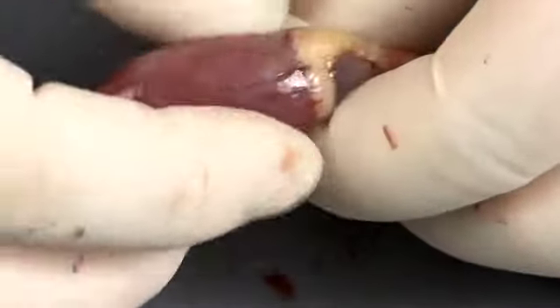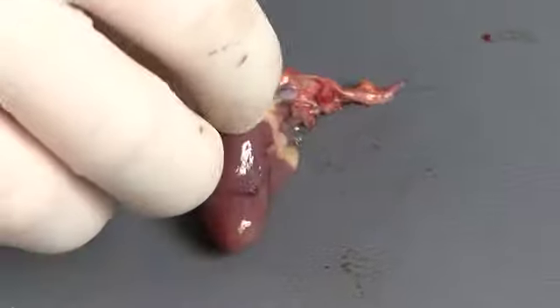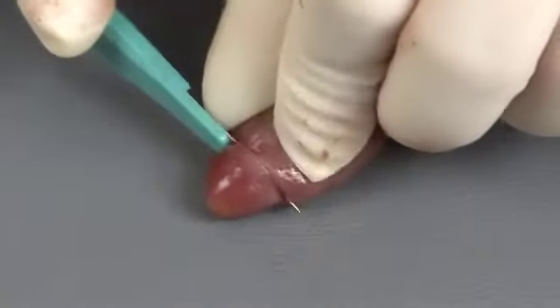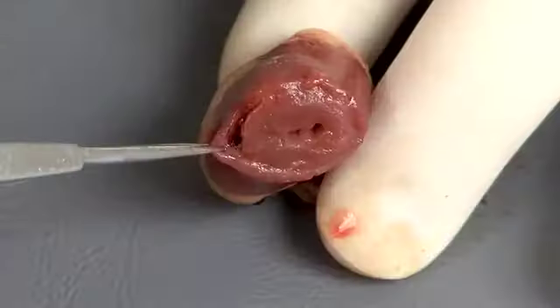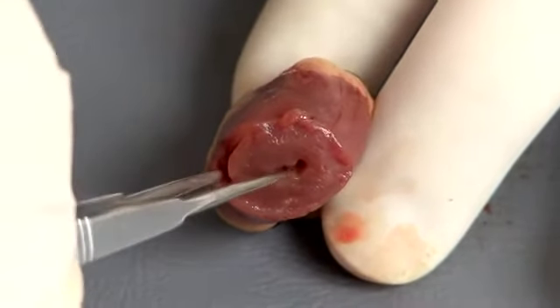Begin by peeling back the pericardium to expose the heart muscle. Examine the epicardial surface. Next, remove the bottom 1/3 of the apex of the heart. This view will allow the thickness of the walls and septum to be assessed.